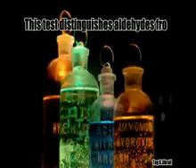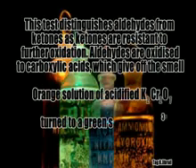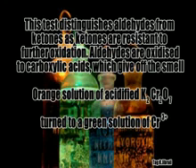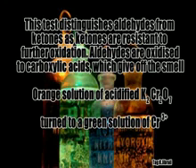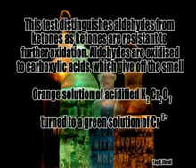This distinguishes aldehydes from ketones, as ketones are resistant to oxidation. Aldehydes are oxidised to carboxylic acid, which gives off a characteristic smell.